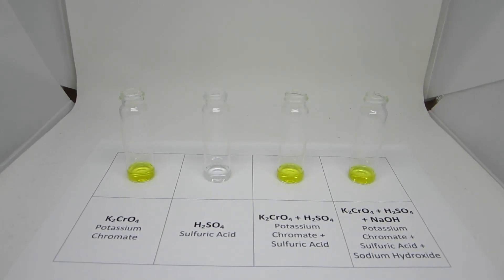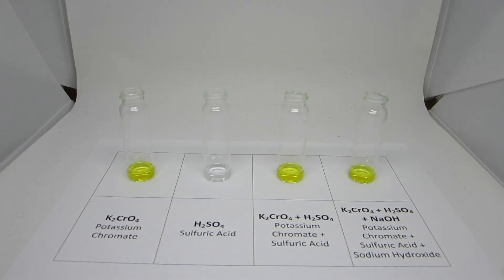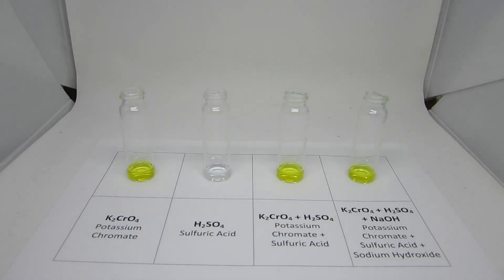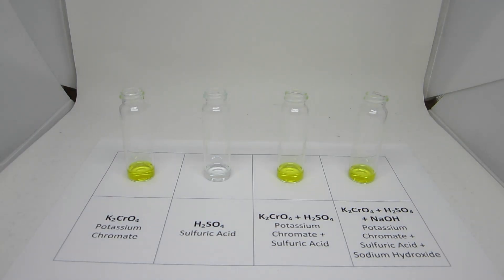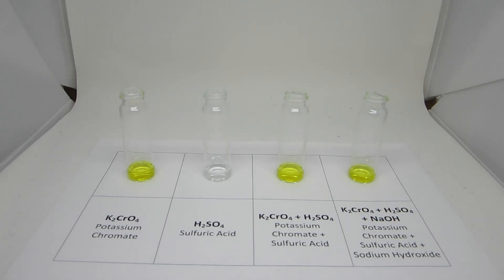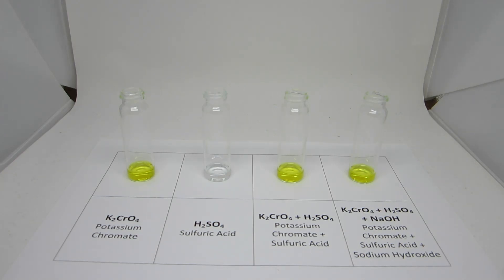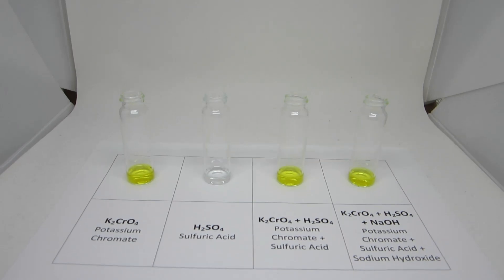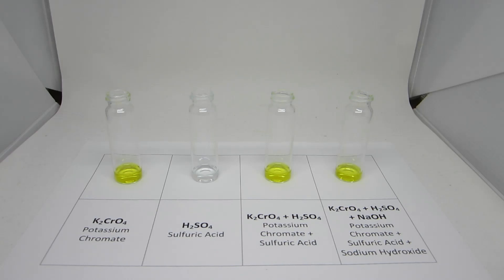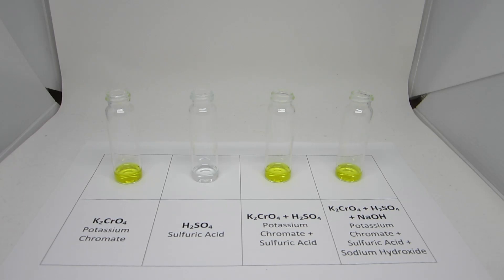In this video, we will be focusing on the concepts of equilibrium and Le Chatelier's principle. We will be focusing on six different equilibrium reactions, and by varying the products and reactants, we can see how Le Chatelier's principle drives a reaction to one side or the other. By adding or removing products and reactants, we can drive the reaction towards one side.